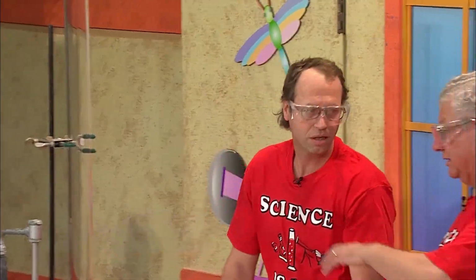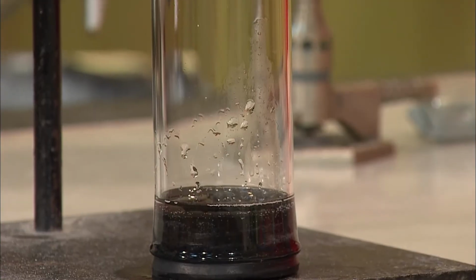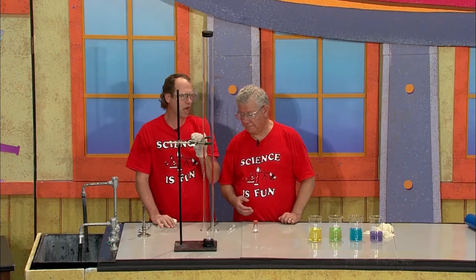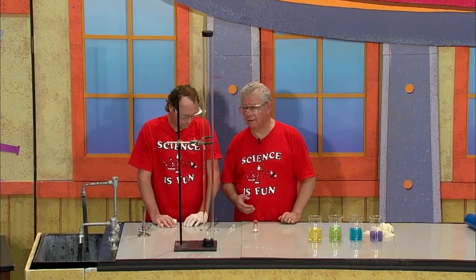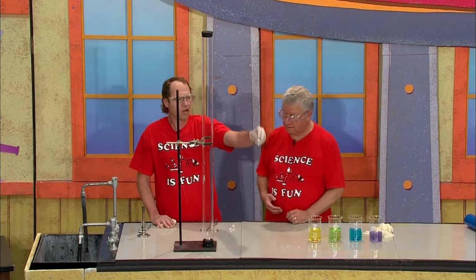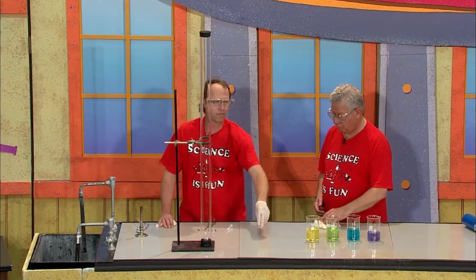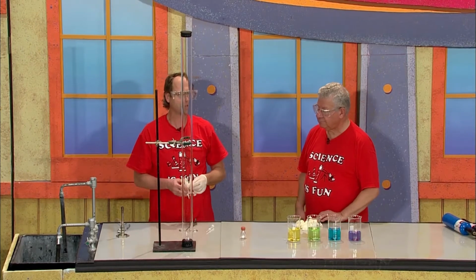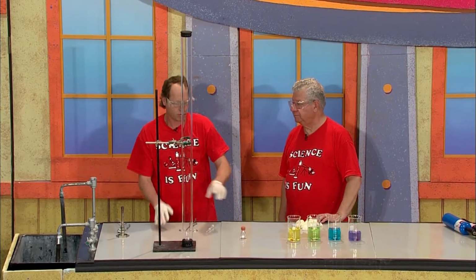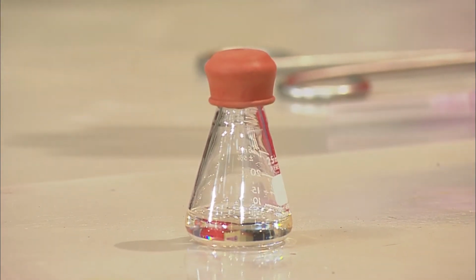This looks like a long glass tube. Yes, it is. It's a long glass tube, and you can notice it's stoppered on both ends. And inside is a clear and colorless gas. It's actually nitrous oxide, also called laughing gas. We're going to do an experiment with the laughing gas. We're going to combine it with this clear and colorless liquid, which is actually called carbon disulfide. It's a foul-smelling liquid like most sulfides, and it has a structure like carbon dioxide. We're going to take this liquid, put it in here, mix them together, and do a combustion reaction.